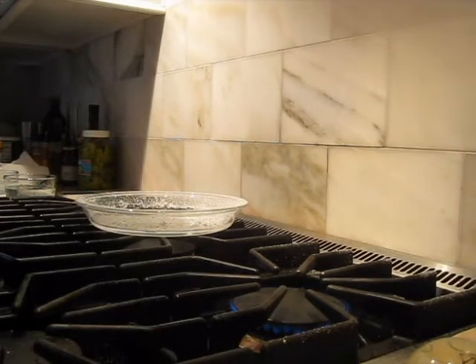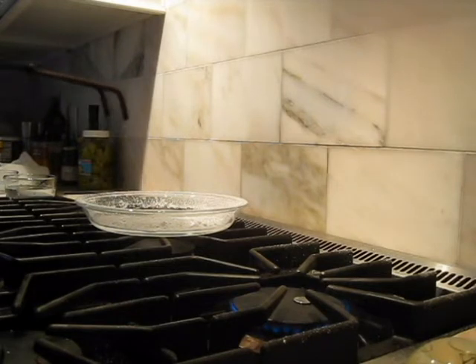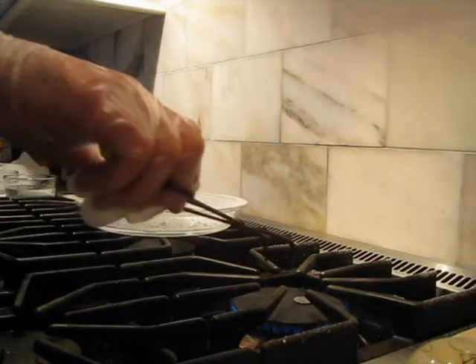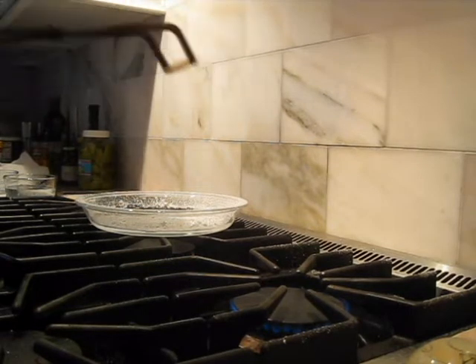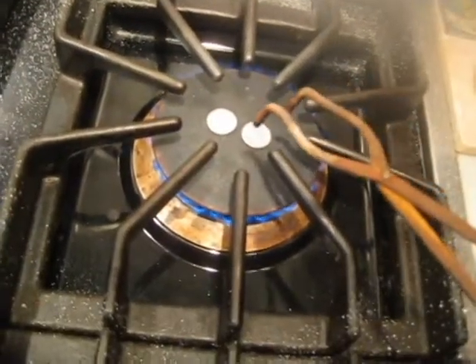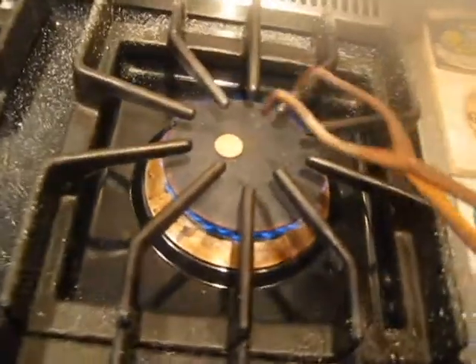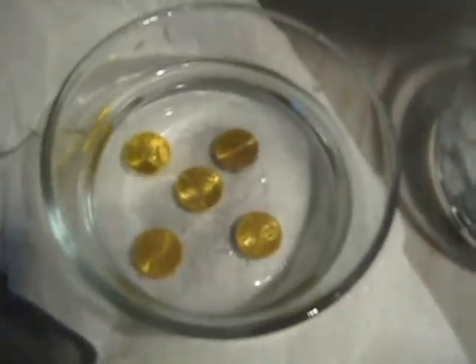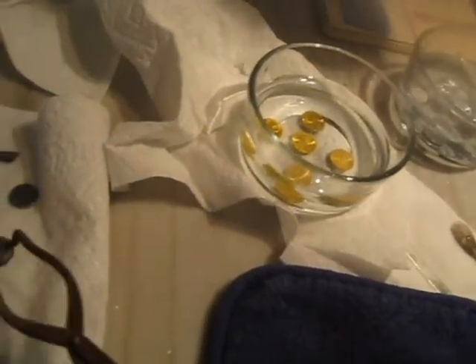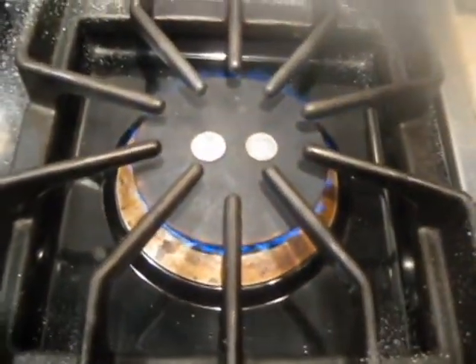You know what? That side is extremely golden. So what I'm going to do is put them on for a very short period of time. It's actually changing color on this hot center plate. Notice that it doesn't appear golden until I cool it in water. I don't expect this to happen with the dime, although there is copper under the dime - but just try it anyway.